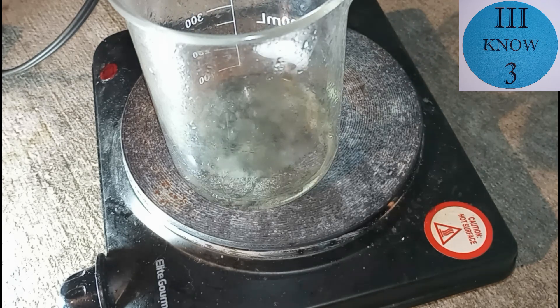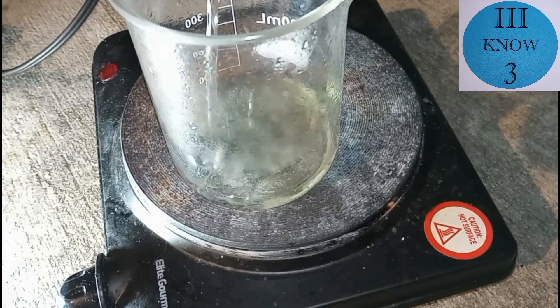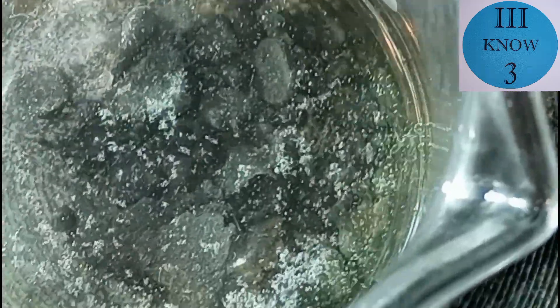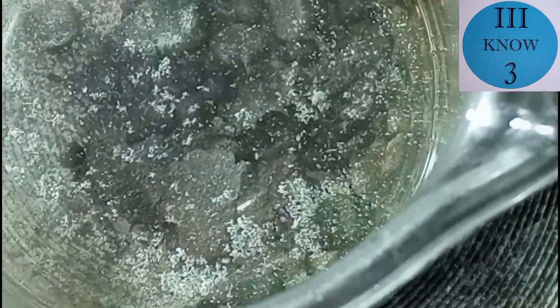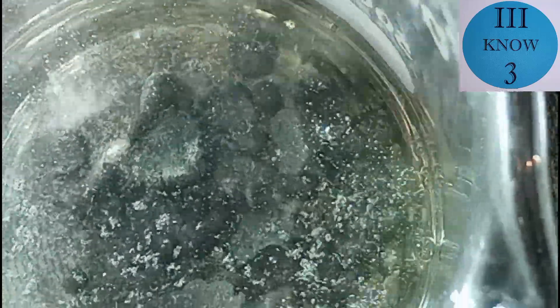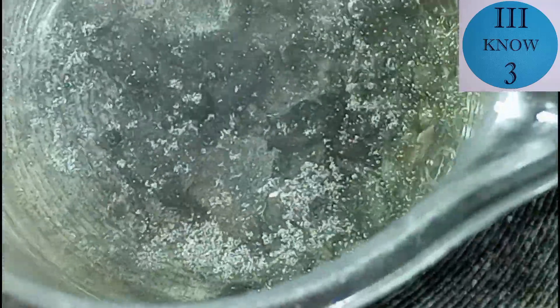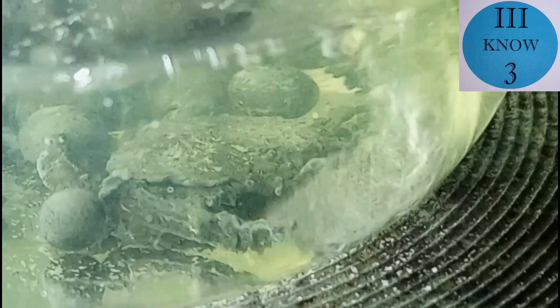And I'm going to try adding about 50 milliliters. After a little while it did look like the reaction was continuing to do pretty well. And maybe the hydrogen peroxide helped. I did notice there were some things floating around in there. And really it looks like the tin may have oxidized and turned black. I can't really tell if it improved the speed any at all.